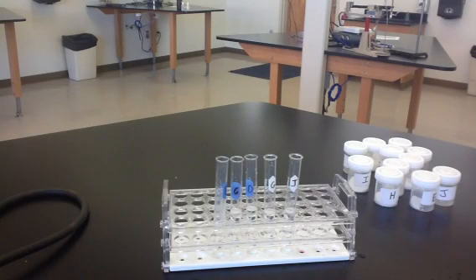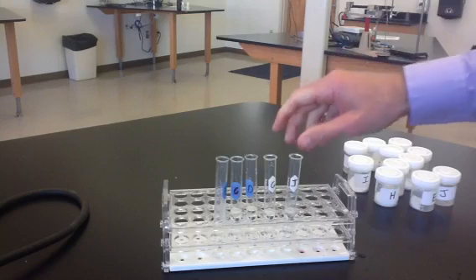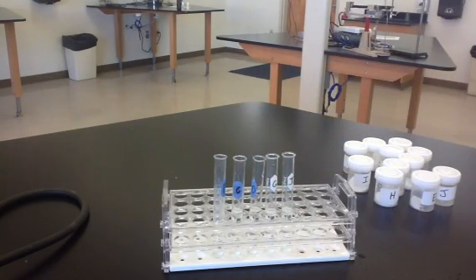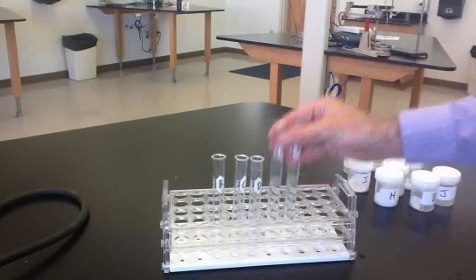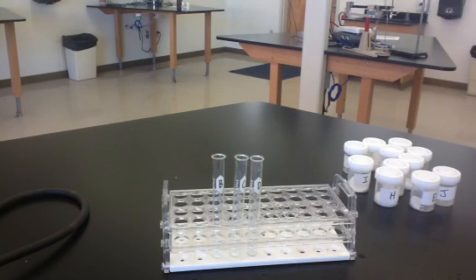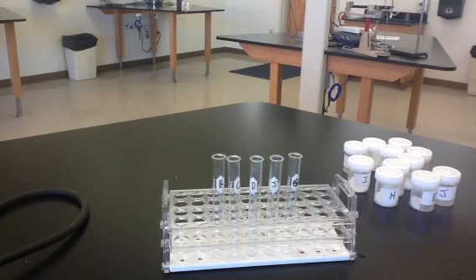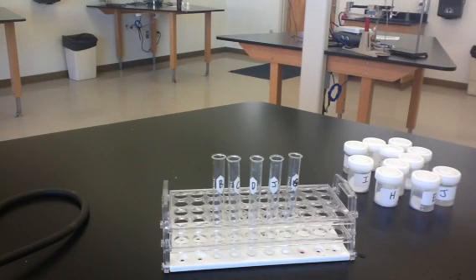This is going to be the test with the Benedict solution. We're going to get new samples of solutions B, C, and D. We'll also replace G and J. These are just fresh samples of the substances that are still to be identified. We're going to dissolve these in a small amount of water.